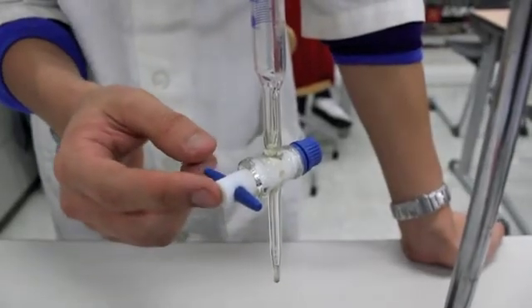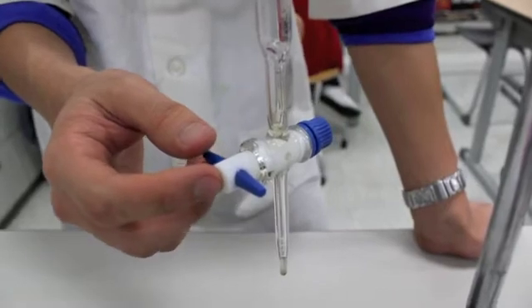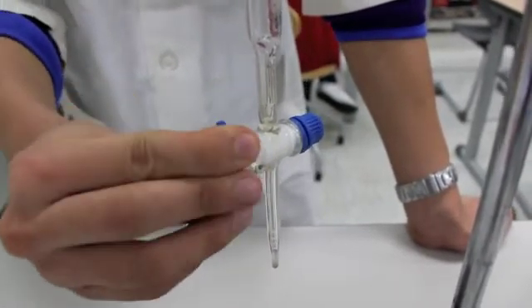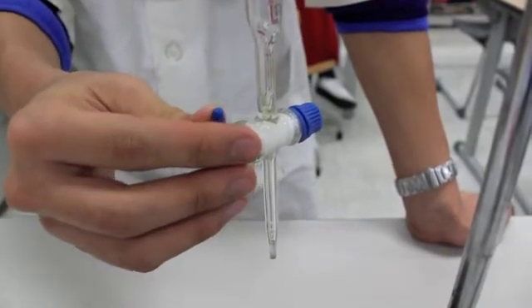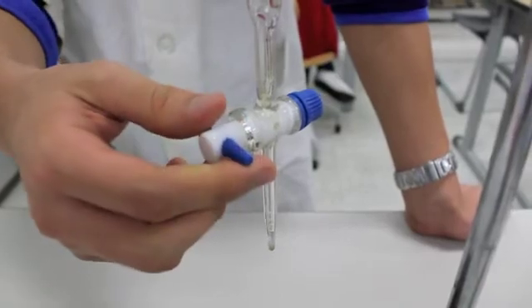This part of the burette is called the stopcock. The stopcock is used to control the amount of liquid used for titration. By putting the stopcock in vertical position, the liquid will be allowed to flow through. By putting the stopcock in horizontal position, the liquid will stop flowing.